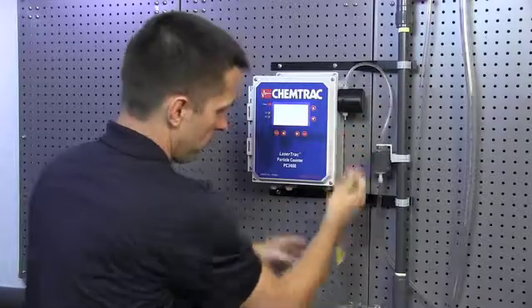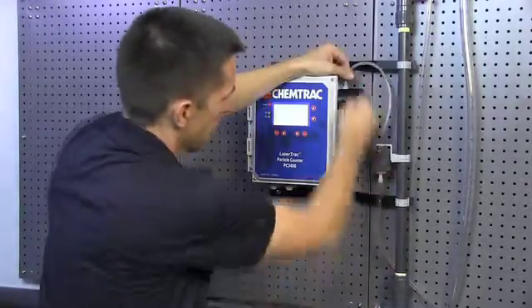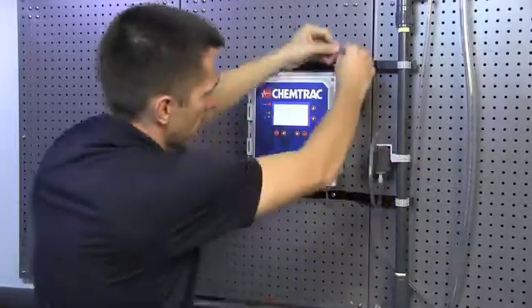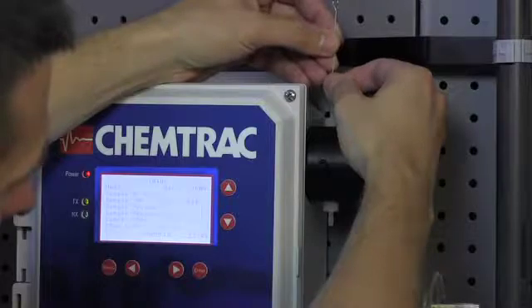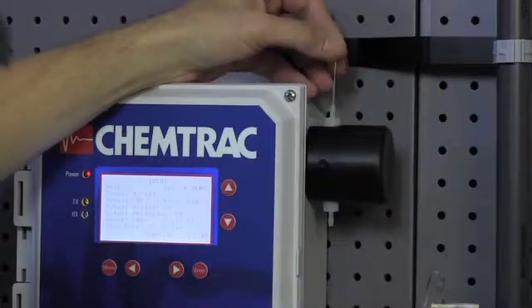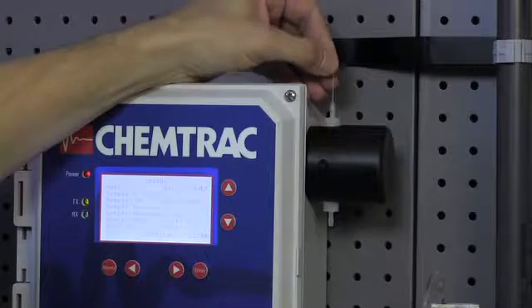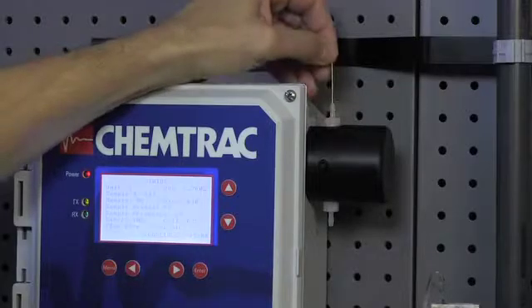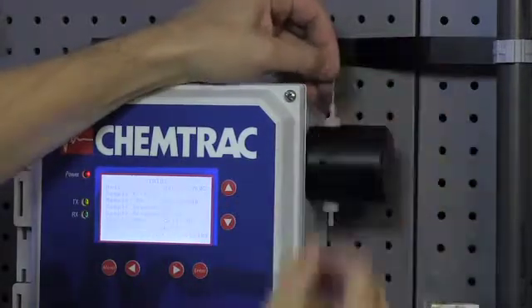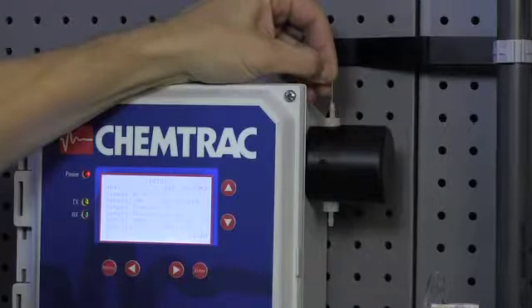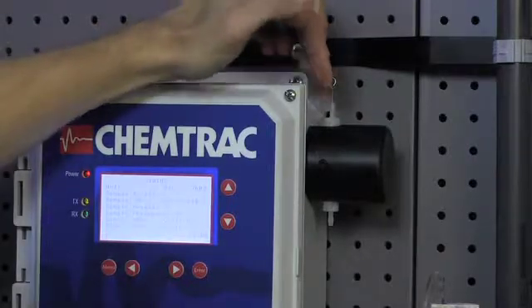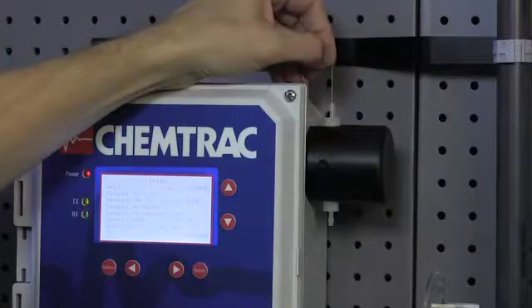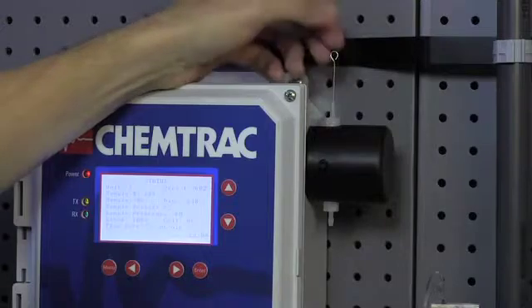Now we'll disconnect the tubing from the bottom of the sensor as well from the top of the sensor. Then we'll use our cleaning brush to clean the sensor. Just carefully insert the brush into the top and gently work the brush down and it will find the flow cell which is only about 750 micron in diameter. It's a pretty narrow flow cell.